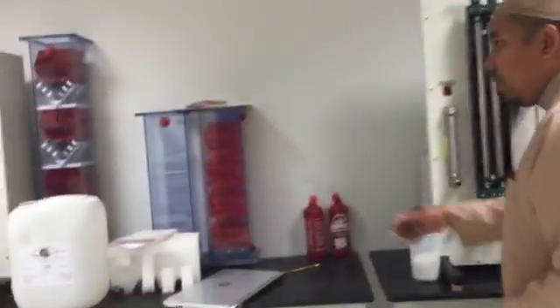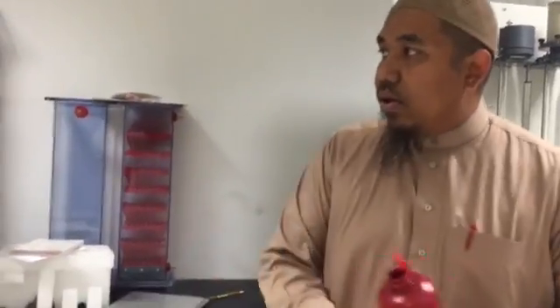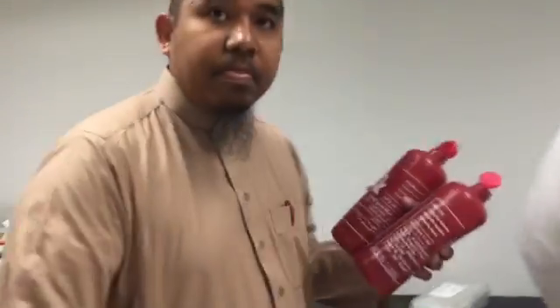Okay, so we have to have a container. I will bring a cutter or something. So now what you have to do is do the first experiment first. I will make a container for you. Doctor, what's the objective again?